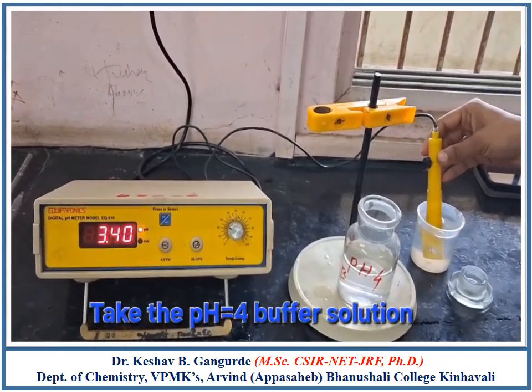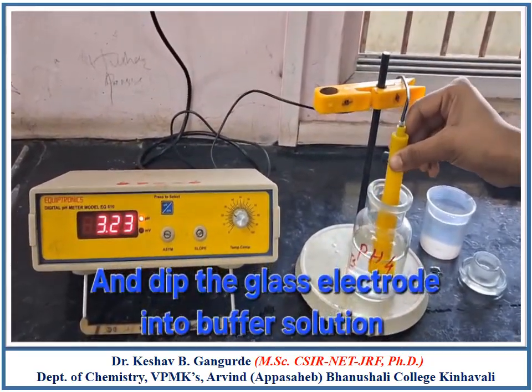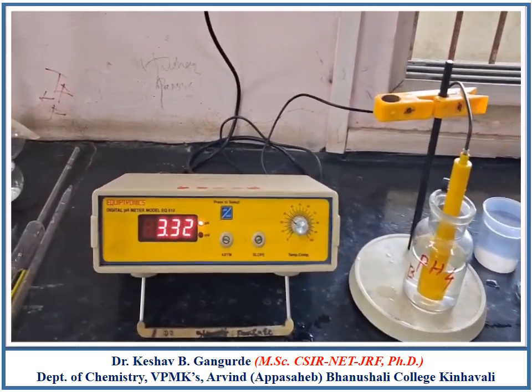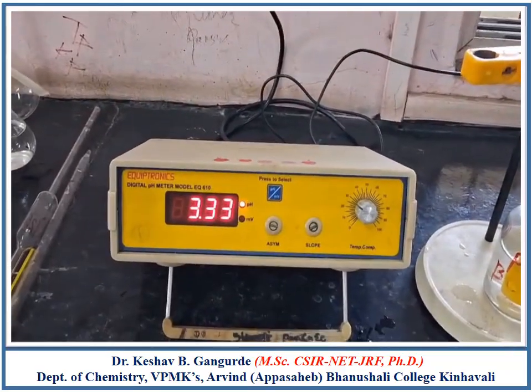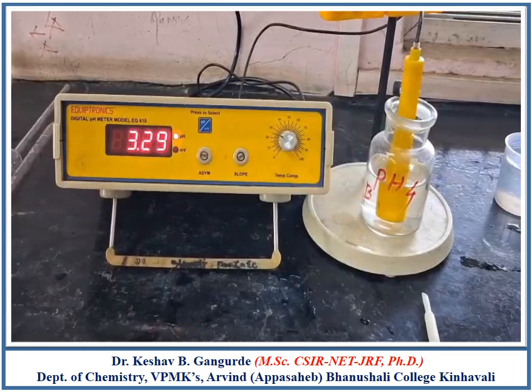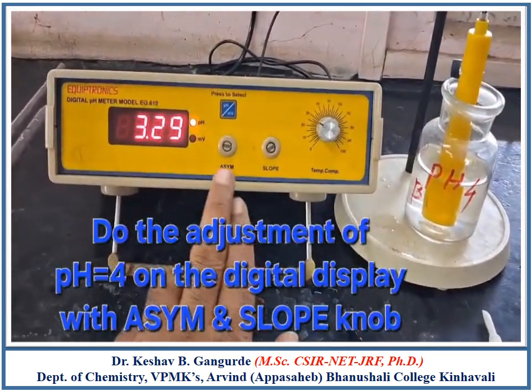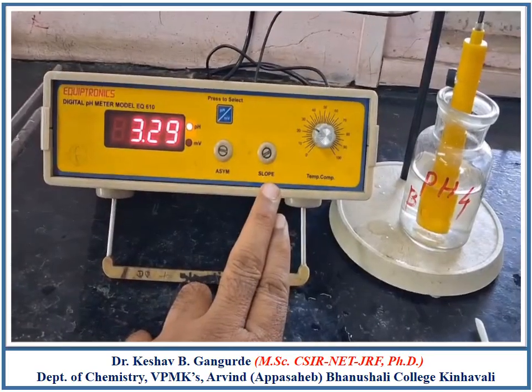Now immerse the glass electrode in buffer solution of pH 4 and adjust the reading on the display of the pH meter to 4. Adjust the pH 4 unit by using two knobs, that is the asymmetric and slope knob.